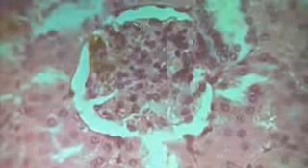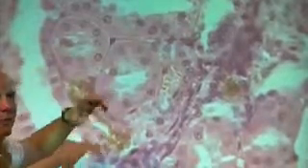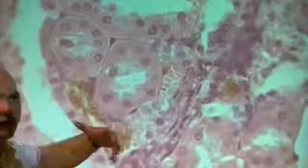Okay, so I'm going to move this one just a little bit because I want to show you here the difference between a proximal convoluted tubule and a distal convoluted tubule is that the proximal convoluted tubule has microvilli. So this is cutting it so we see the tube, right? And you're seeing a bunch of microvilli right there, inside of the middle of the tube. Or as I like to say, it looks like a bunch of stuff in the middle of the tube. So both of these are proximal convoluted tubules. They got a lot of stuff in the middle of the tube.